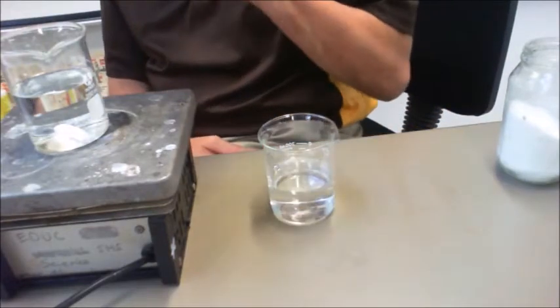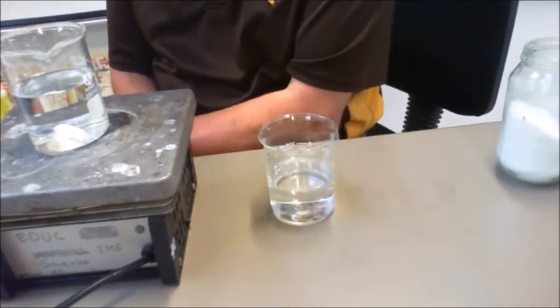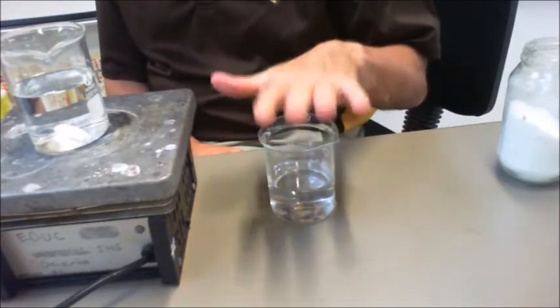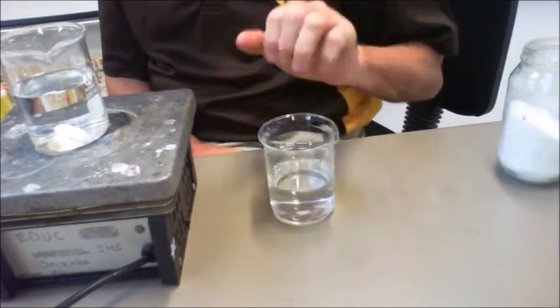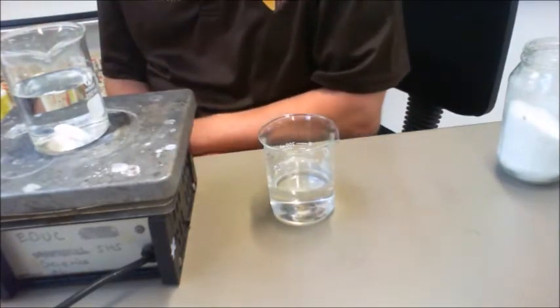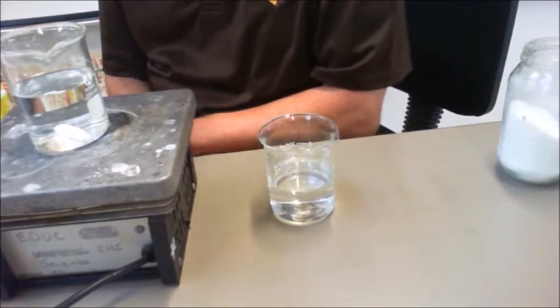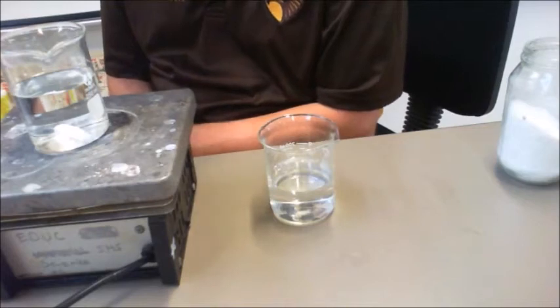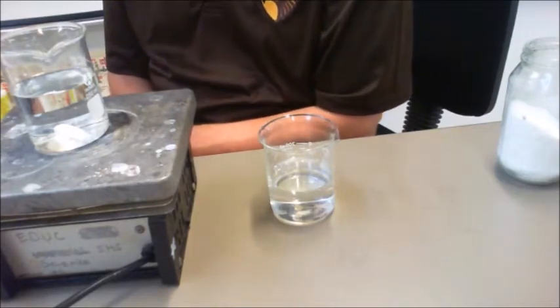We have a beaker filled with 150 milliliters of water. We will put one sugar cube into this beaker and leave it unstirred, and we'll put another amount of sugar into this beaker and have it stirred electronically by the machine that we have here.